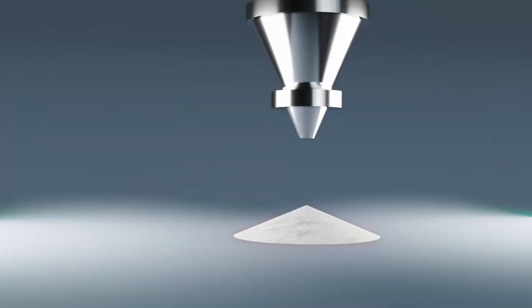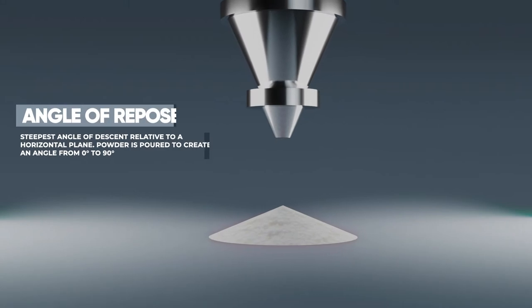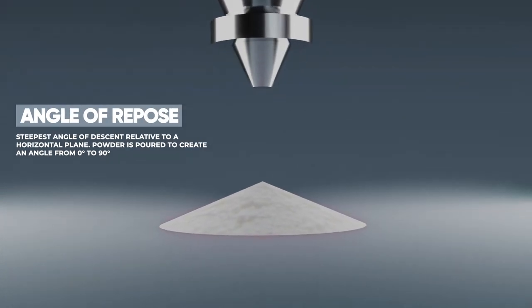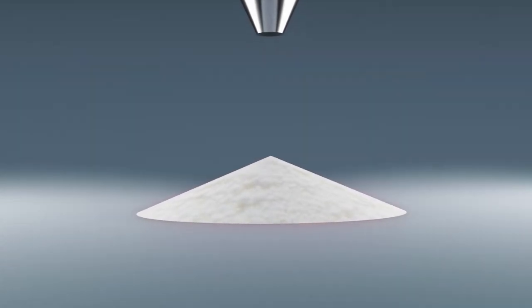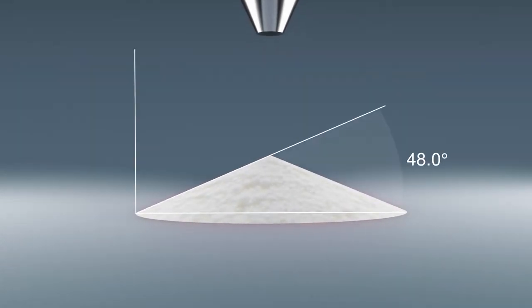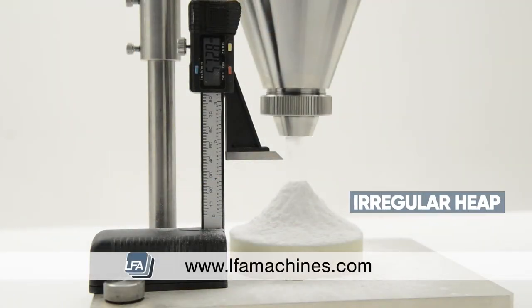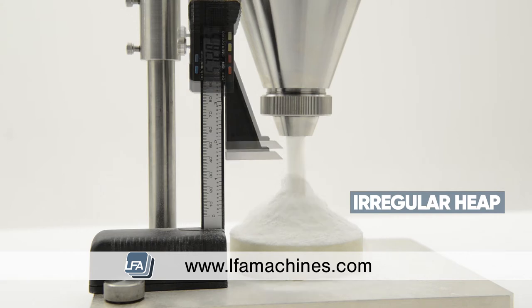The angle of repose, or critical angle of repose, of a granular material is the steepest angle of descent relative to a horizontal plane. When powder is poured, it creates an angle from zero to 90 degrees, revealing the properties of the powder. A cohesive powder will form an irregular heap, whereas a non-cohesive powder will form a regular conical heap.